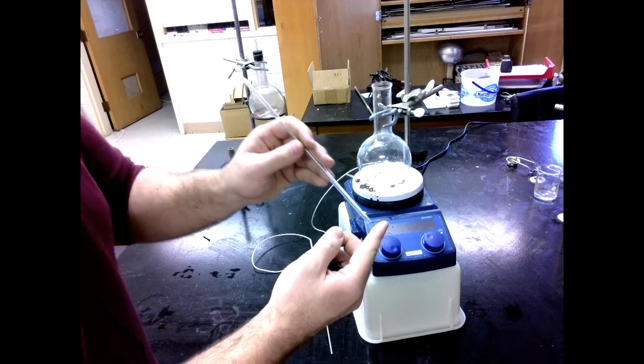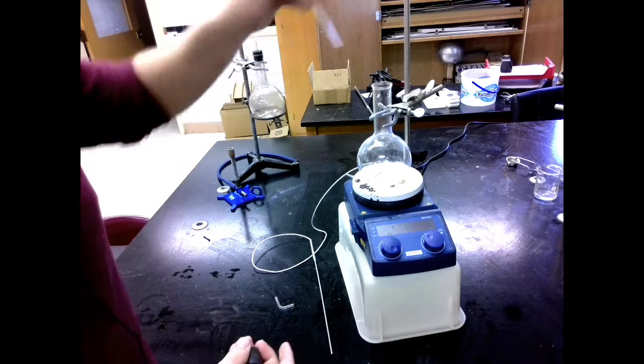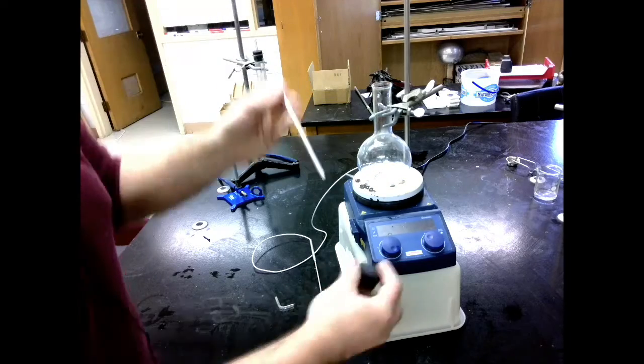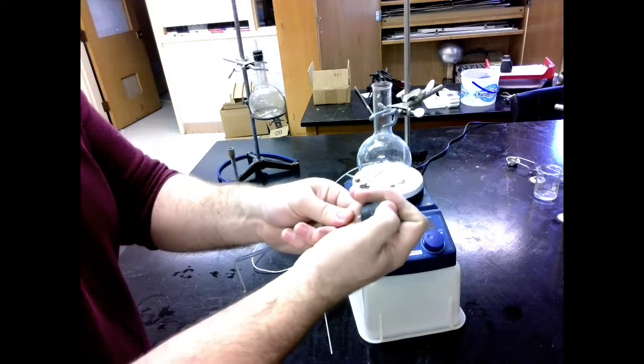We don't want it too high. It should be in the organic material, seated in there properly. So we're going to make sure that we have it placed correctly with the cork. So I'm going to place it through my cork, just pushing that through just like I did before.